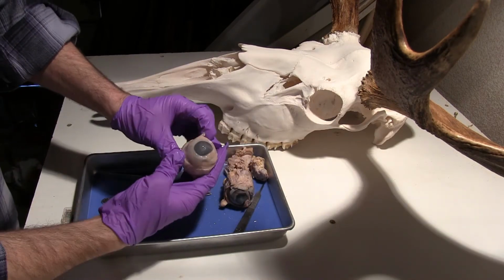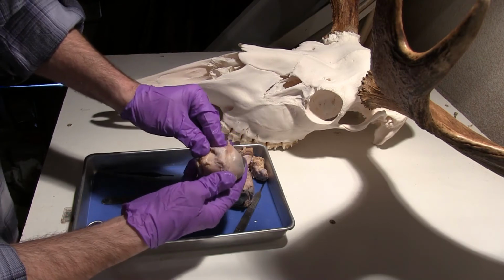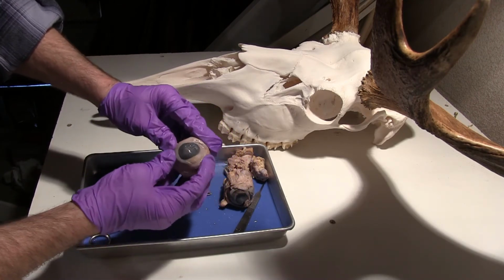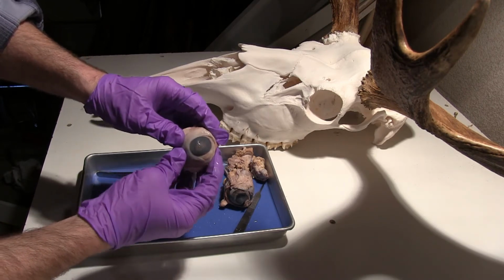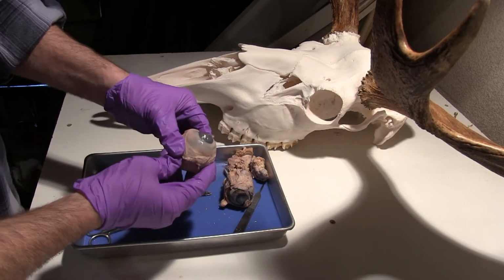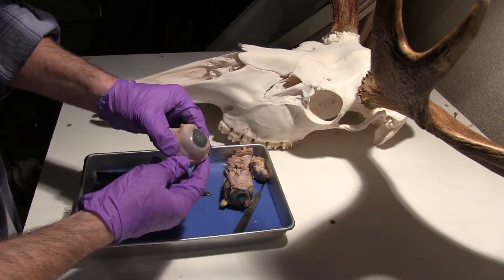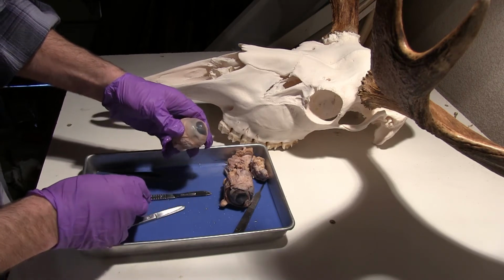Okay, so there I have quite a bit of the fat pad, the cushion, as well as the extrinsic muscles removed. Pretty happy with where we're at there. Now, what I'm noticing is that there's fluid inside of this anterior portion, and there's also fluid in the posterior portion. Now, when I open that up, it's going to come out in both areas. And what I'll do first is I'll actually go into the anterior portion of the eye here.